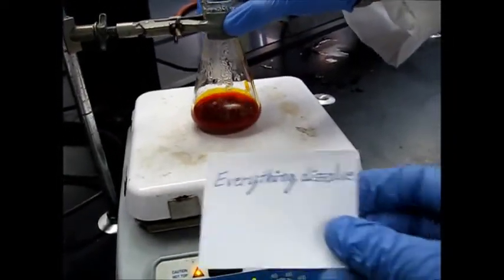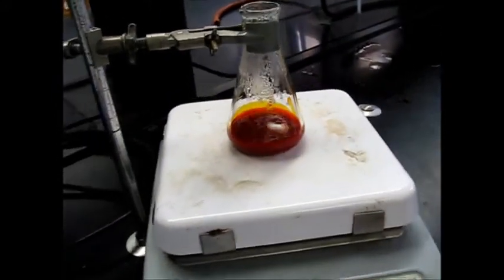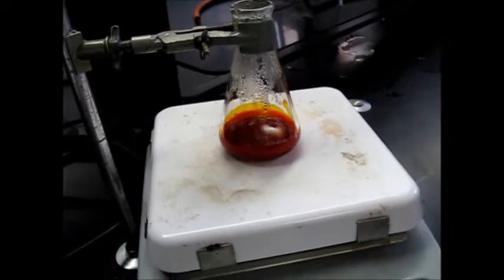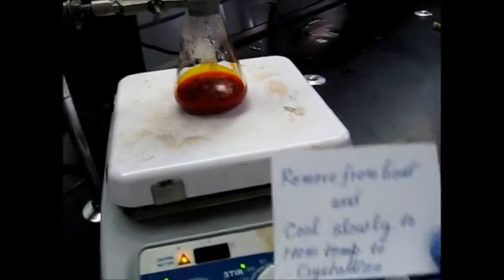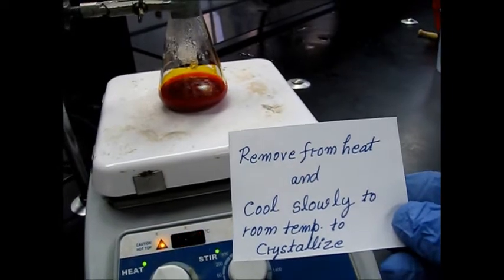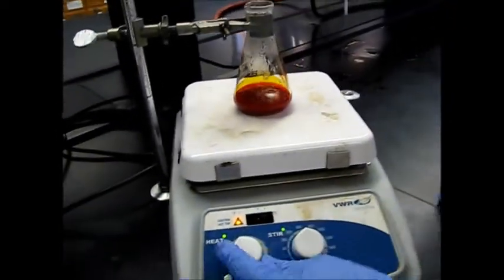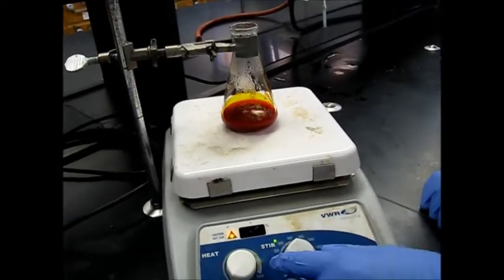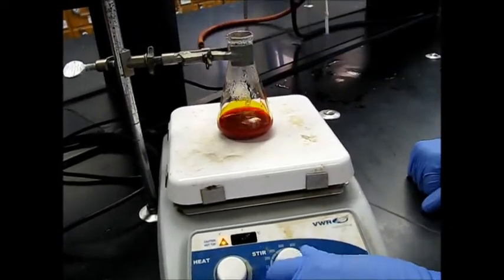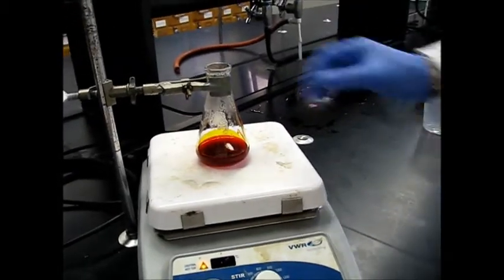So we've finally gotten everything to dissolve for the most part. So for this next part we just need to recrystallize the methyl orange. So we'll take it off the heat, let it cool just to room temperature, and then we'll put it in an ice bath and get it to be really cold. So we'll go ahead and turn off the heat, and we can turn off the stirring as well, just to kind of help promote the crystals to start forming.